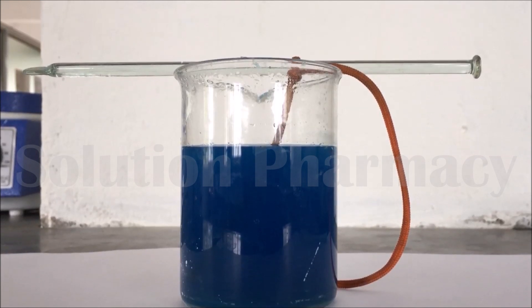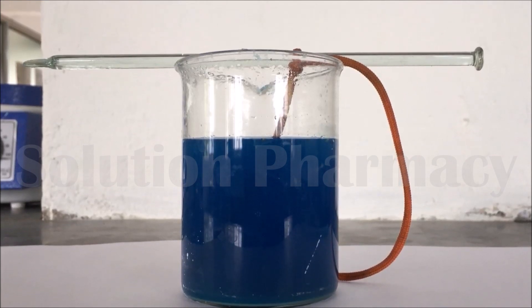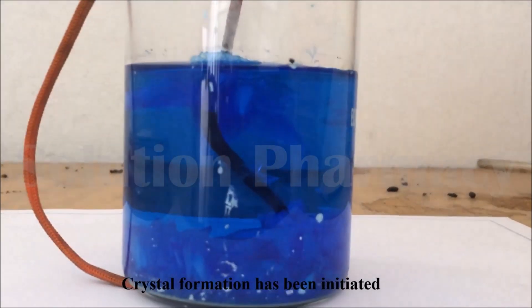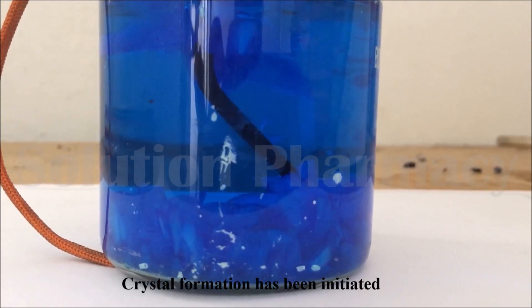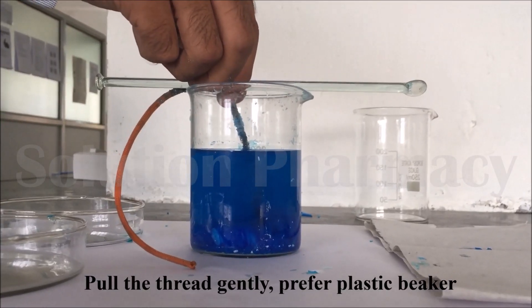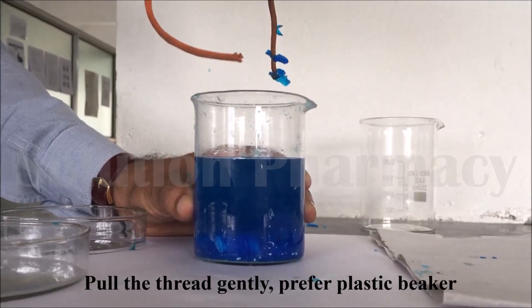During this period, the copper sulfate particles spontaneously arrange into a repetitively orderly manner, meaning in a regular geometric pattern — that is called a crystal, and the process is known as crystallization. After one day, you can see that crystal formation has been initiated at the bottom of the beaker. If you observe from the top, you can see crystals forming on the thread as well. After three days, or after completion of the crystallization process, gently pull the thread — you can see crystals formed on it.